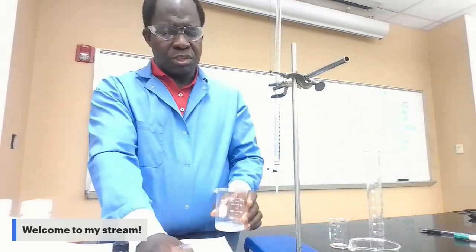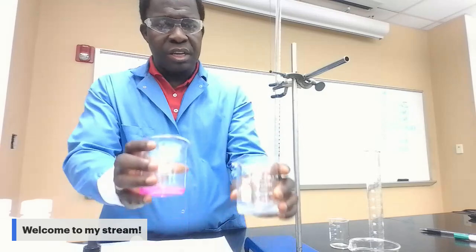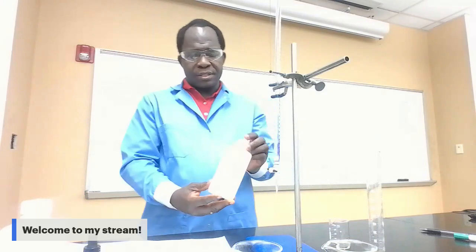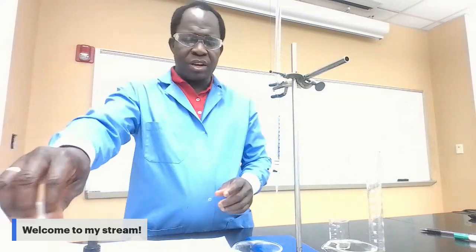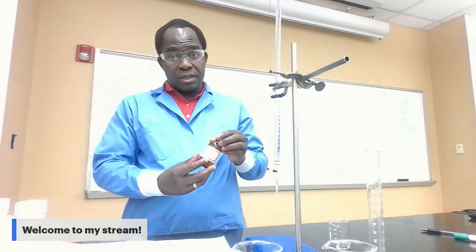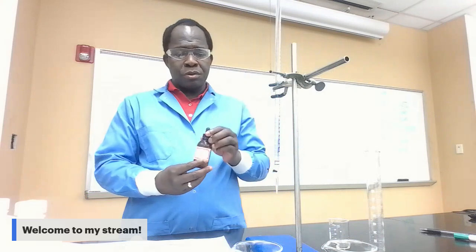Okay, now part two is the titration. Before you proceed to the titration in part two, you need to fill the three 250 milliliter beakers with 20 milliliters of calcium hydroxide. After you fill them with 20 milliliters of calcium hydroxide, you need to add 5 drops of phenolphthalein to each one.